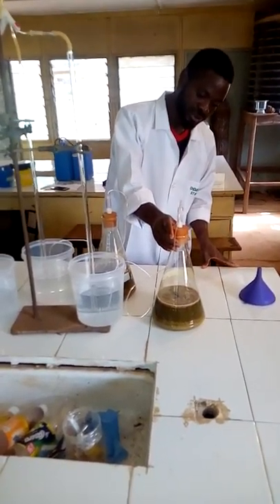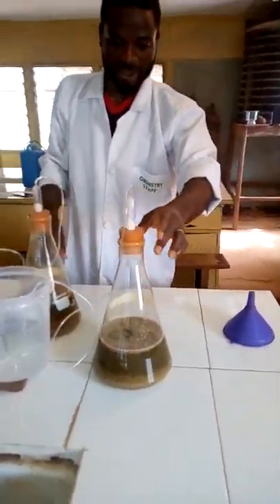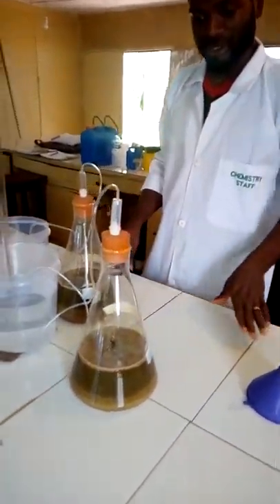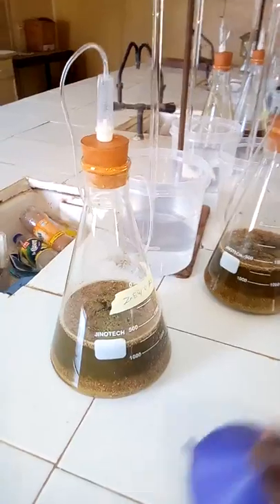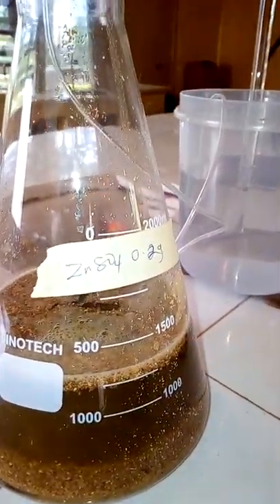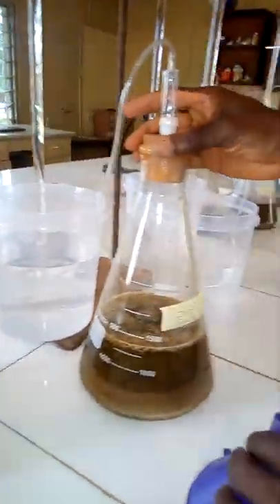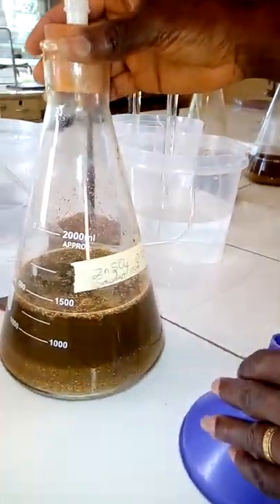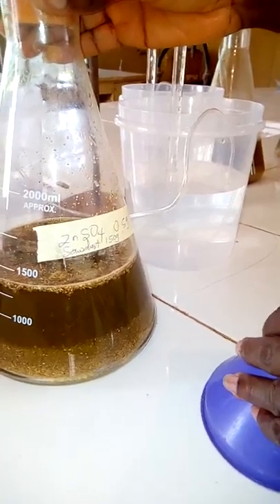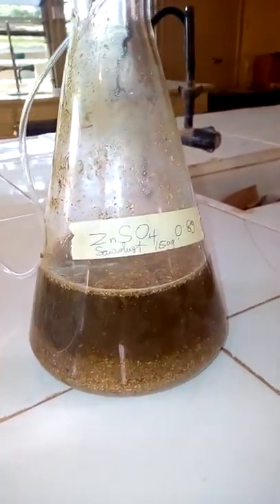In the first stand, the first set of conical flasks is used to study the effects of trace elements on biogas production. We are varying the mass of zinc sulfate: in the first conical flask it is 0.2 grams, in the second it is 0.05 grams, and in the third it is 0.8 grams.